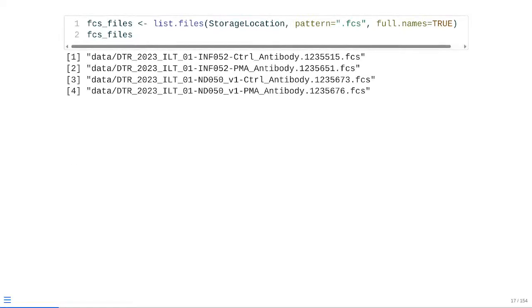From there, we just need to identify our FCS files. Basically the same kind of setup, but we're just changing the pattern to be .fcs. At that point, we're able to find the FCS files present within that same folder. For this example, these fully stained files include both the control and the PMA condition for infant 52, which was a cord blood donor, and then control and PMA for our adult donor, ND050.